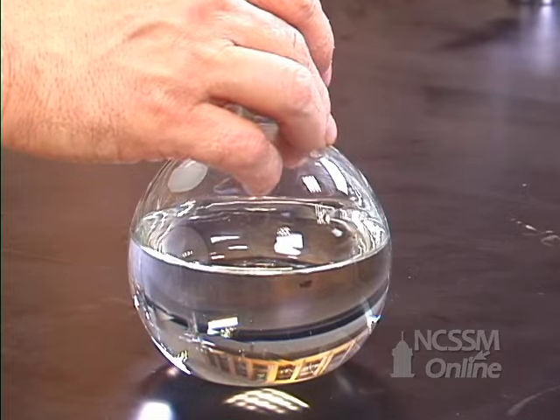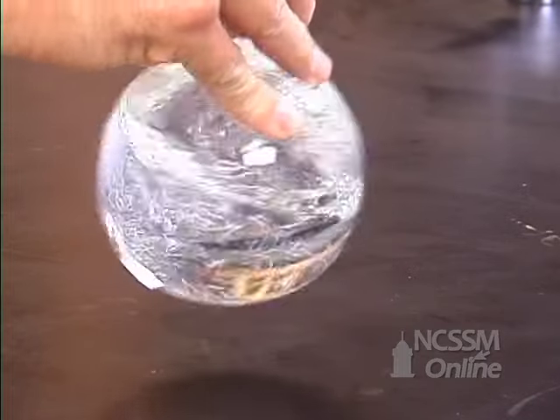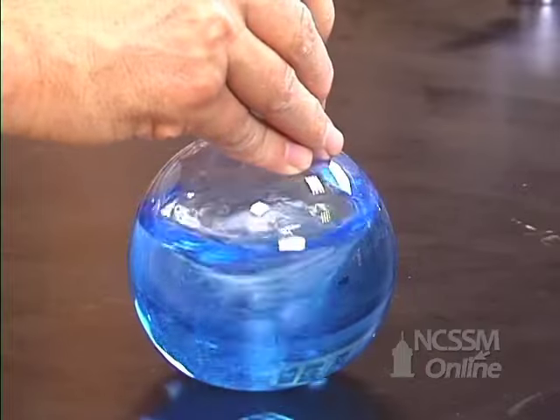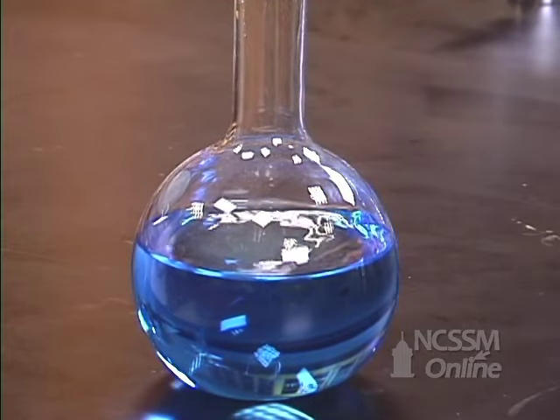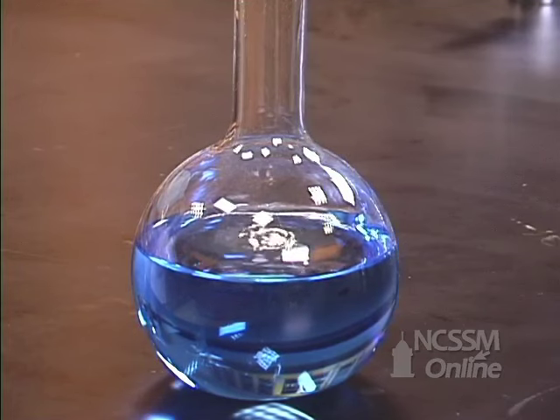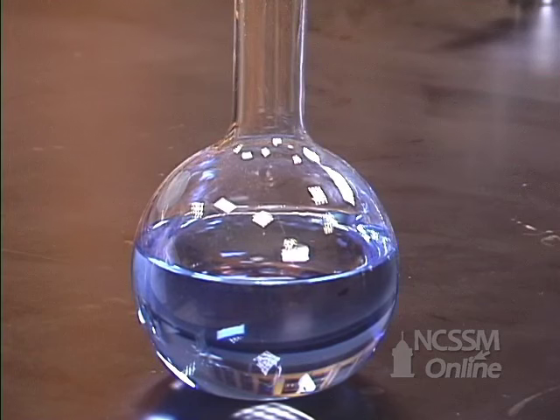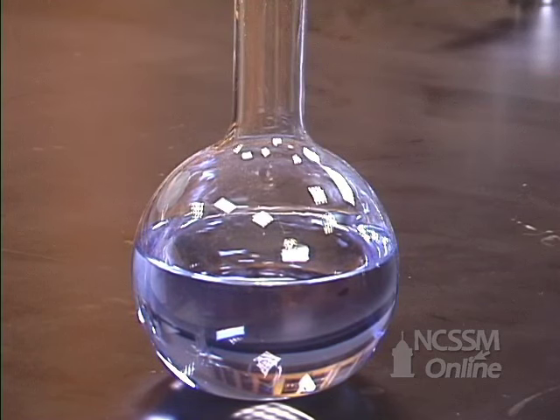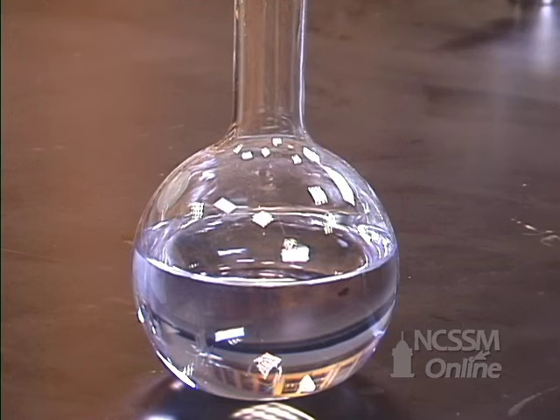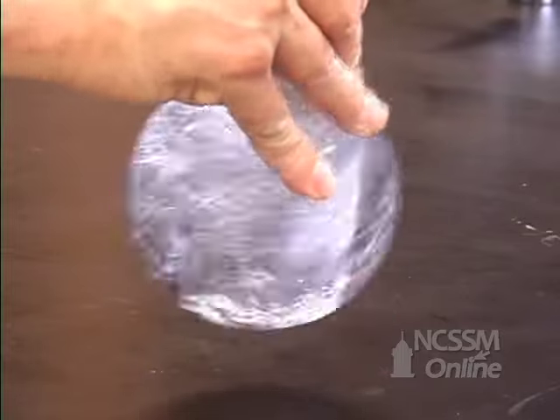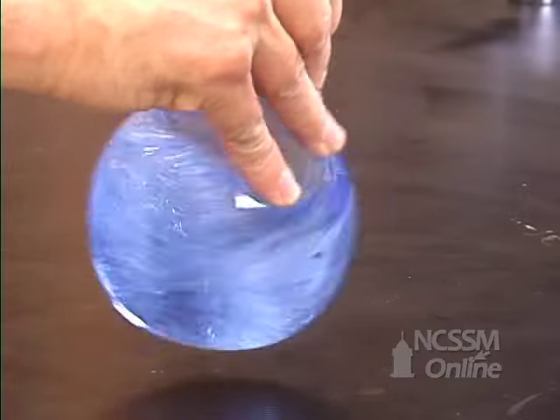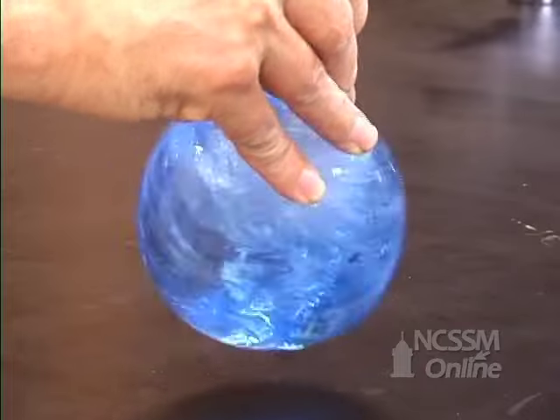I'm going to swirl the flask again and let it stand.